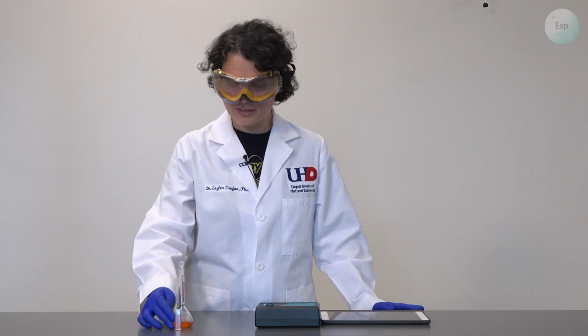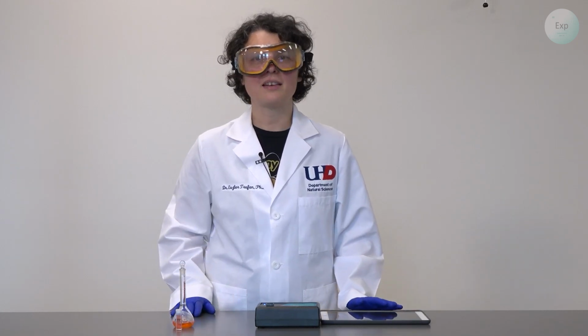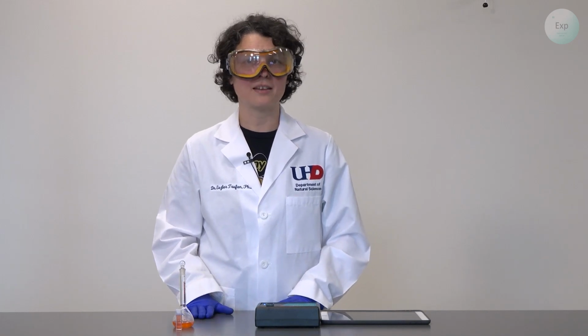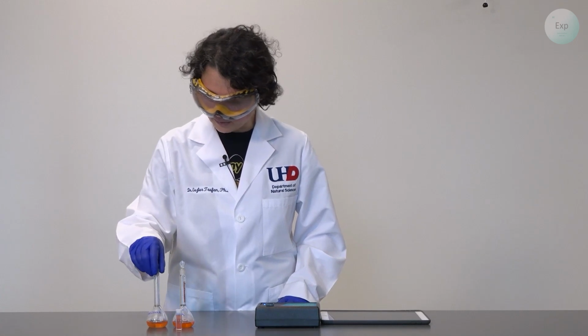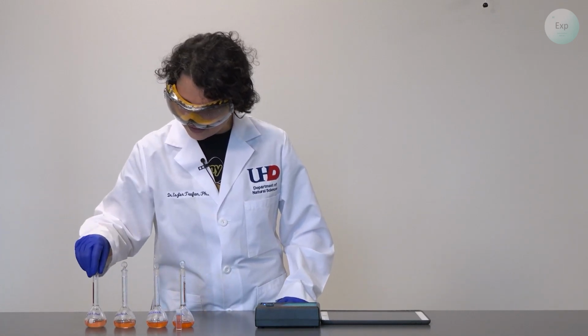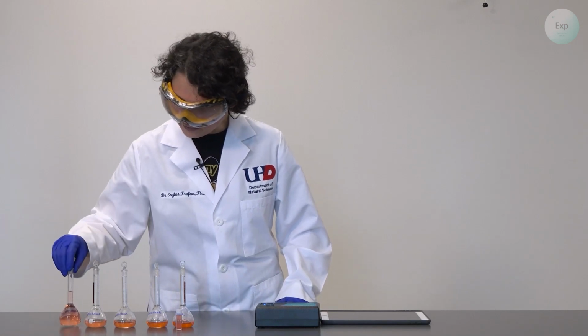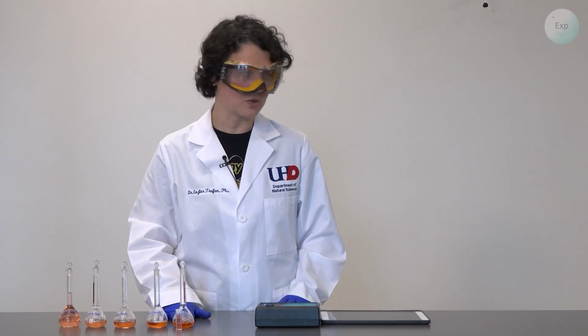It is important that we collect the first measurement on this sample so that we know which wavelength to monitor to establish the linear dependence. Next, we're going to bring in all our differently diluted solutions. And in this case, I labeled them with the respective dilutions compared to my stock solution.